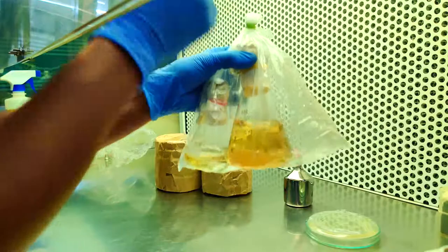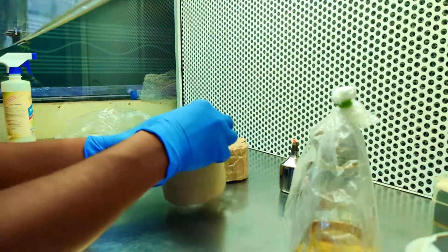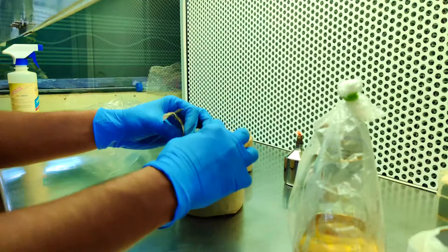This is agar medium and this is broth which we are going to use to subculture this bacterial culture. First we will pour this agar medium into the plates and solidify, then we can subculture for tomorrow's work.